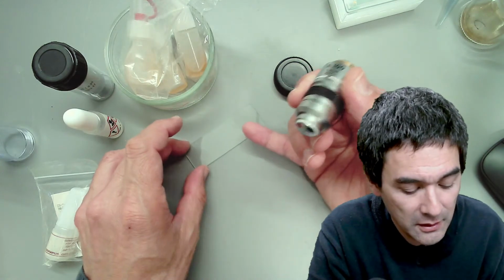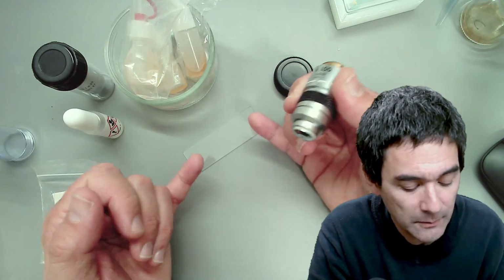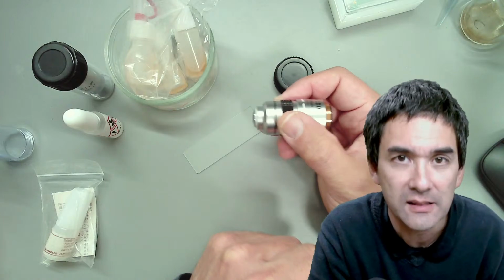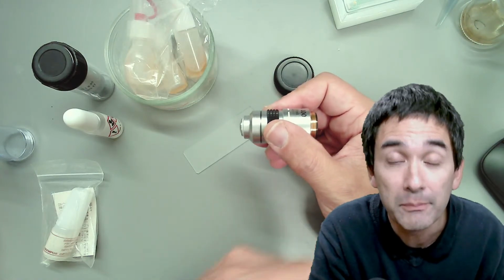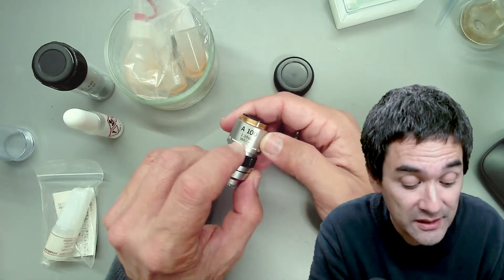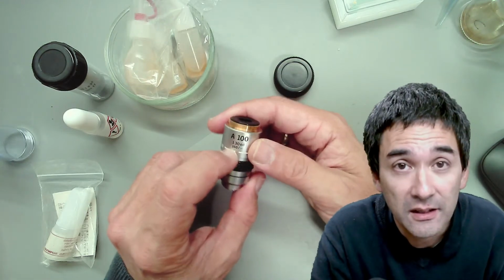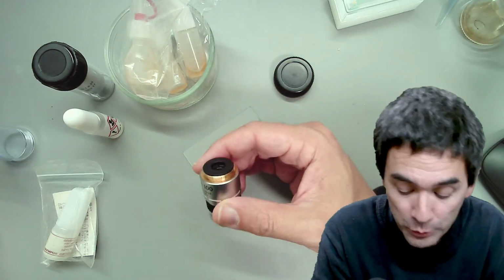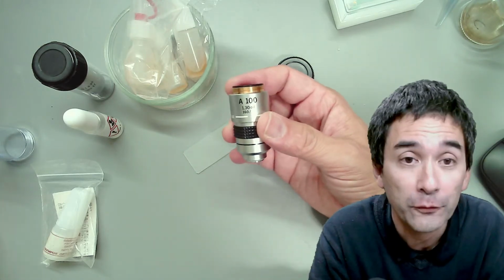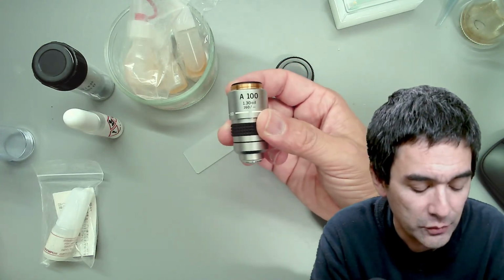Because the air has a different refractive index than the oil, if there is oil between the front lens of the objective and the slide, then you have a better resolution. The image is also brighter. However, you can only use this technique with oil immersion objectives, and in most cases this is the 100 times magnifying objective. There are some companies that also offer other magnifications with oil immersion, but generally I would say it's the 100 times.